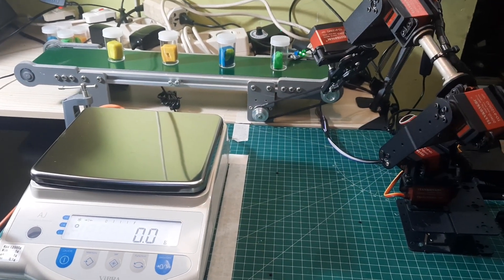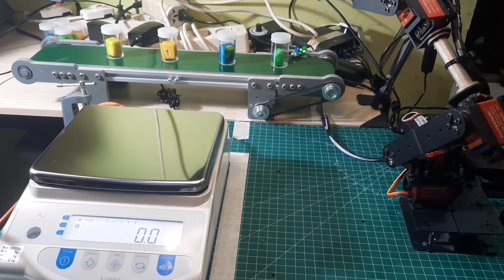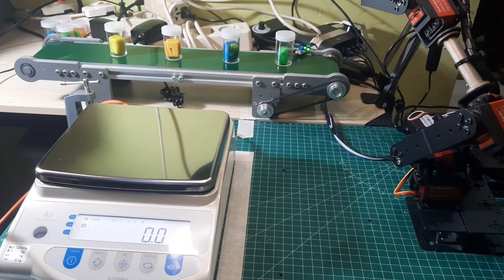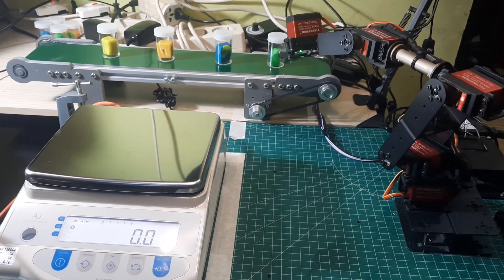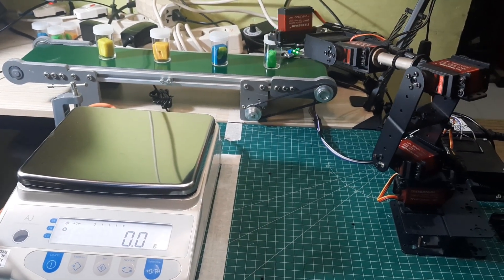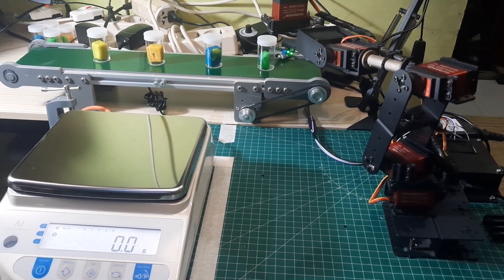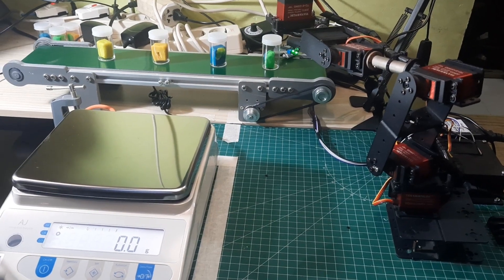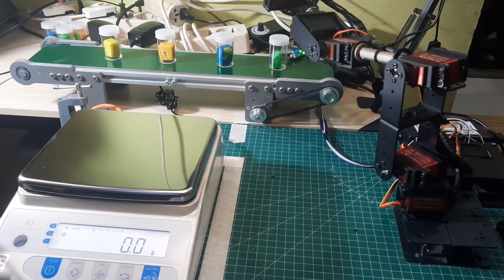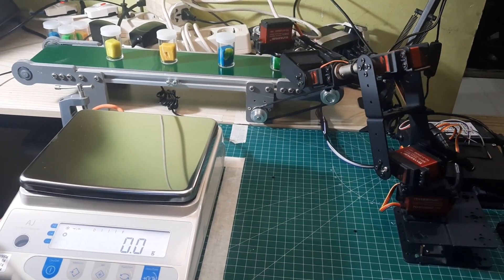When picking up the cup from the conveyor, pay attention. Before the cup is placed on the scale, Node-RED will perform a tare process first to ensure that the scale is in a zero position before weighing the item.